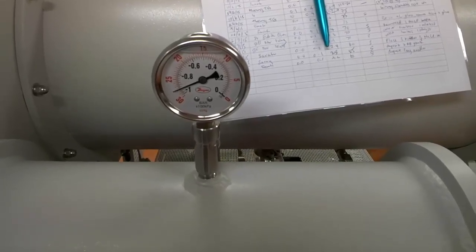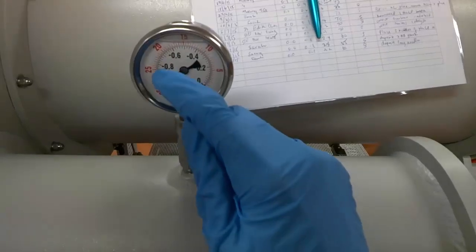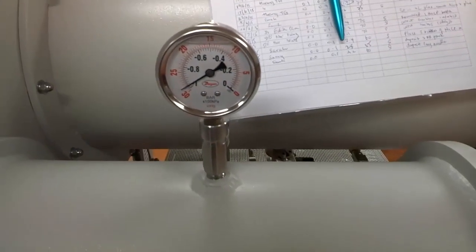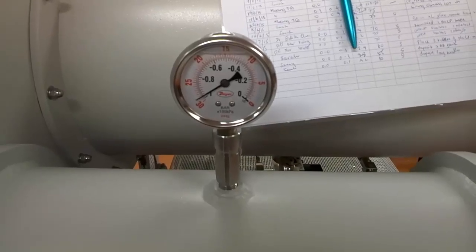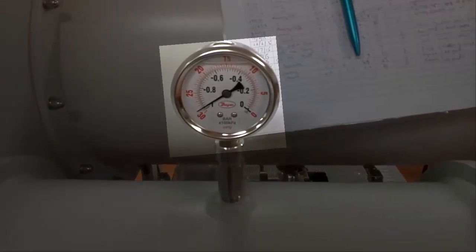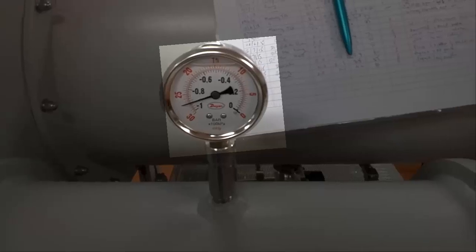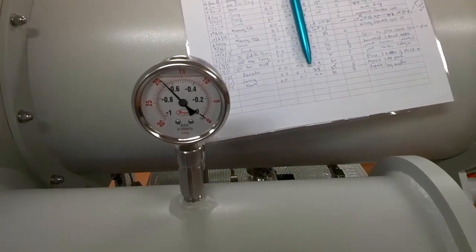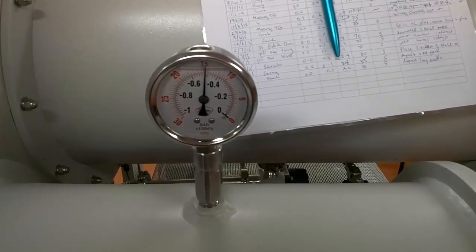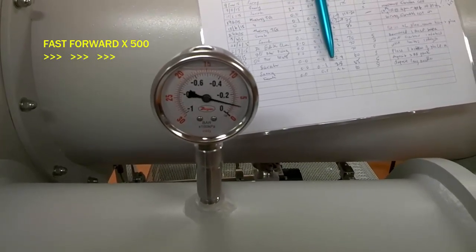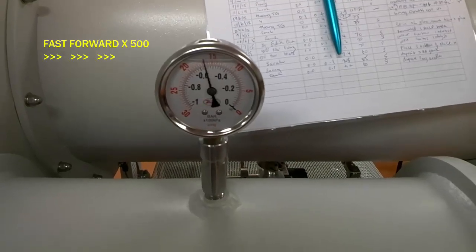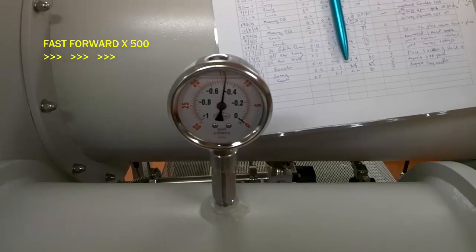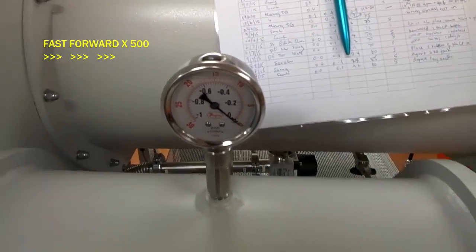Again, rotate the valve carefully, not too fast. We do not want all the air to be sucked out so quickly. Again, topple your glassware. When the meter reading shows about negative 28, you can start to turn it back to nitrogen. Remember, when the antechamber is under vacuum, we cannot open the door. So now, once it is flushed three times, it is now filled with nitrogen gas and we now open the door.